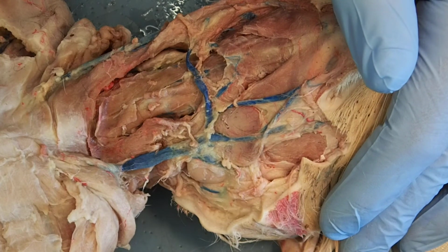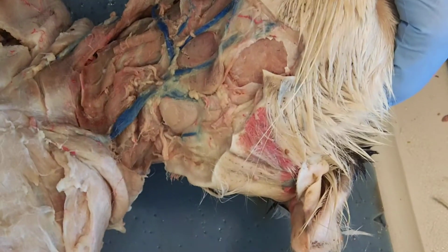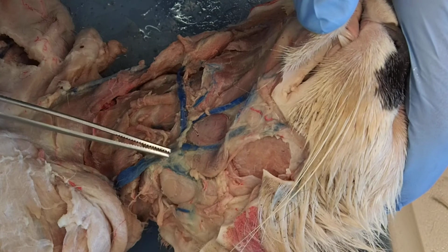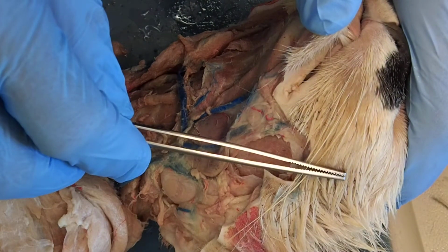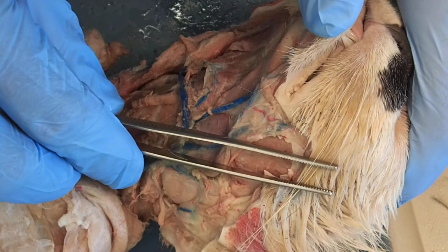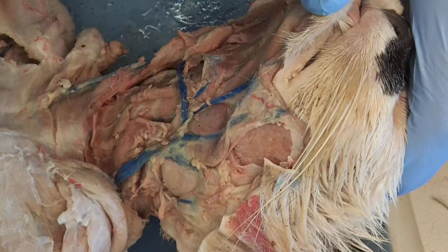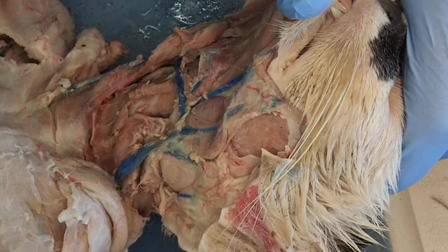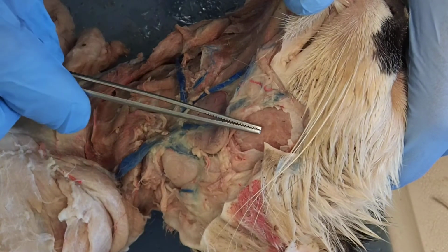There's two more muscles that I want to show you real quick. If I look to the side here, it would actually be running deep to these glands that I showed you earlier and running up. So basically following the line of my forceps. So you can see it here. That's my masseter muscle. That's what helps close your jaw and macerate your food, your masseter muscle.